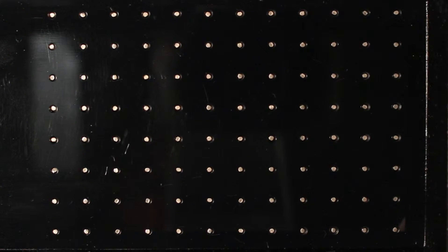Here you can see there's a stir element in each hole in the dispenser. They are now ready to be dispensed in the microplate. It's important to note that you should not flip over the dispenser at this point.